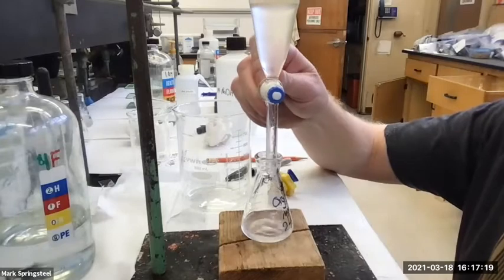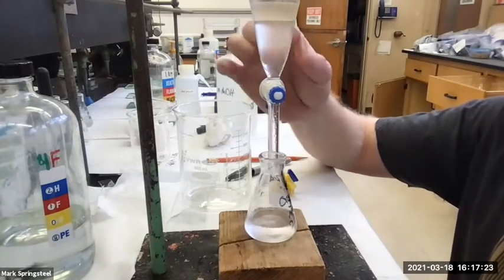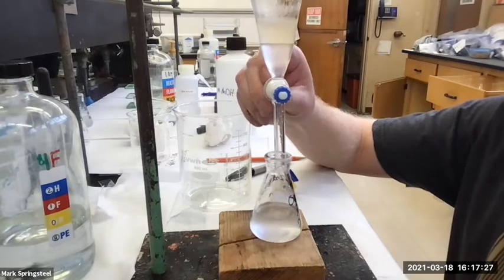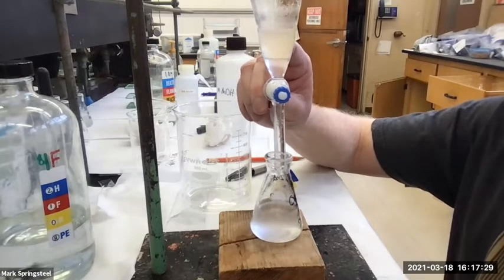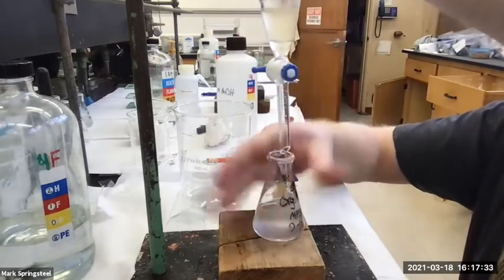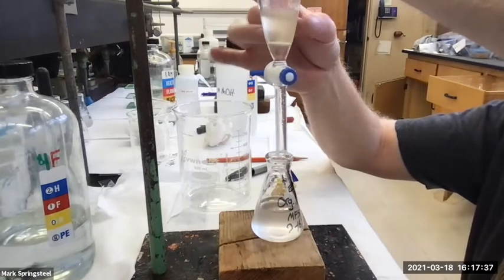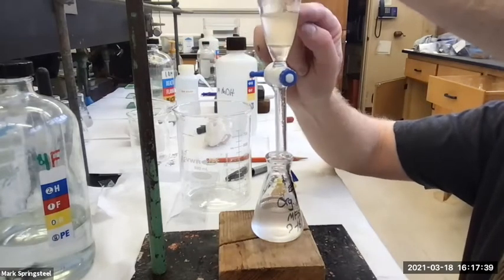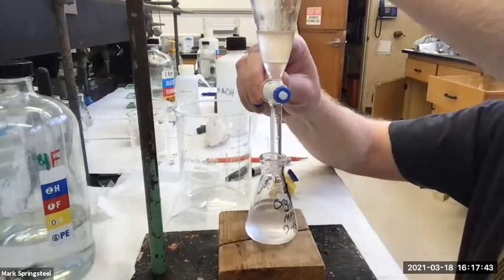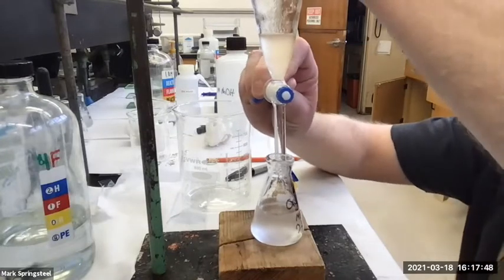So we're draining. And now you're going to see the 2 layers coming down. And as it gets close, about here maybe, I like to stop. And then, as I said before, you give it a tap. It might be hard for you to see because that upper aqueous layer is cloudy, but I see little beads of organic layer dropping down. And I keep draining, go slow. Oop, almost there.